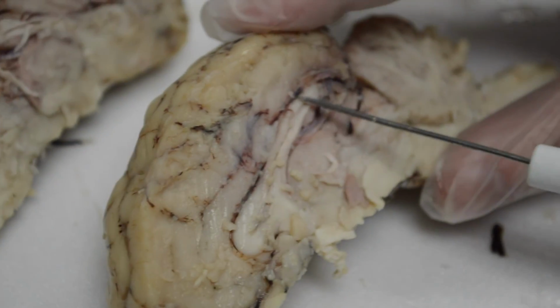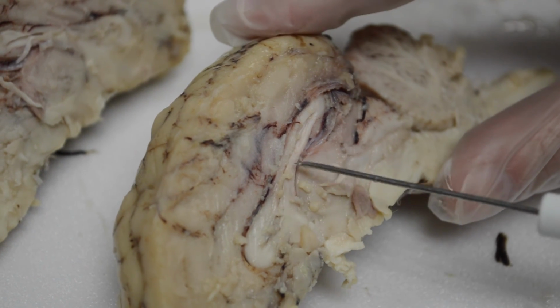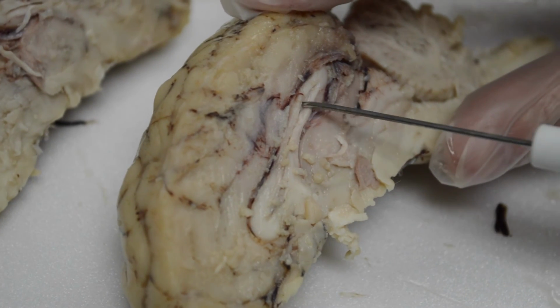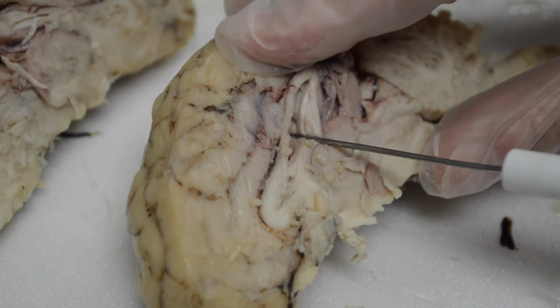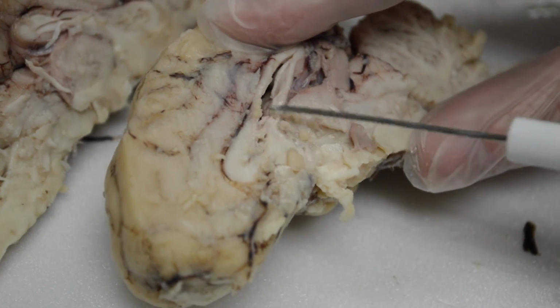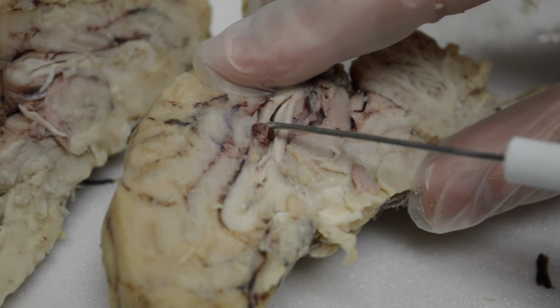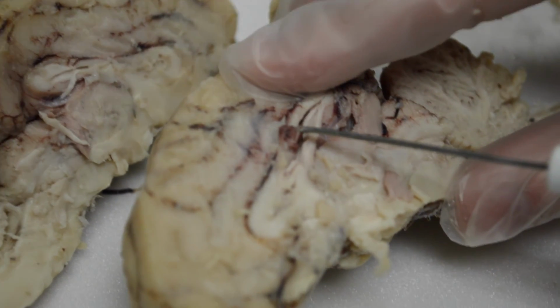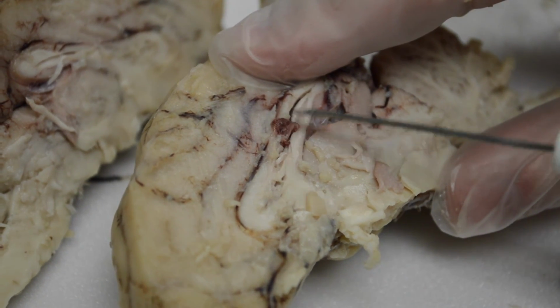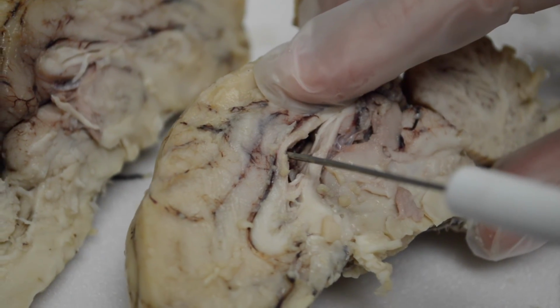Okay, so we have two ventricles on the top. There are 4 total ventricles that make and then help to circulate cerebrospinal fluid. So the 2 at the top, right here is one on this half that we've cut. And there are little cells. See the purple there? That's blood vessels. Oh, there's a nice blood vessel, like the capillaries, and our little ependymal cells are attached there. And they filter then the cerebrospinal fluid, make it from the blood. So they're up in there on the roof of the lateral ventricle.